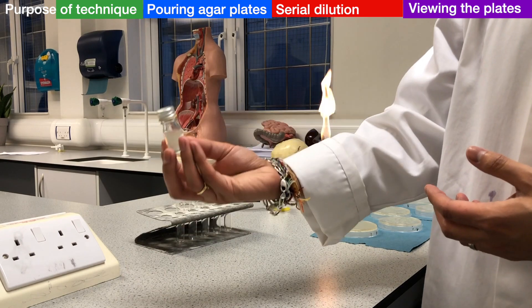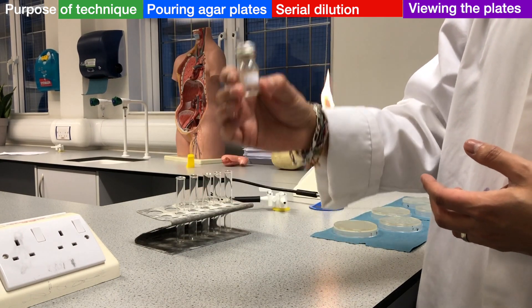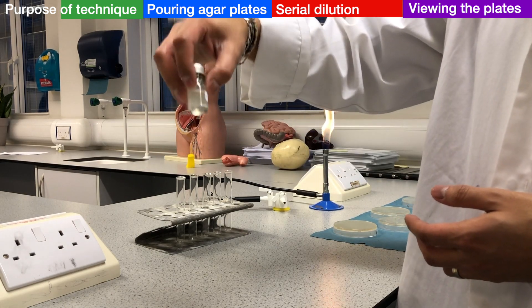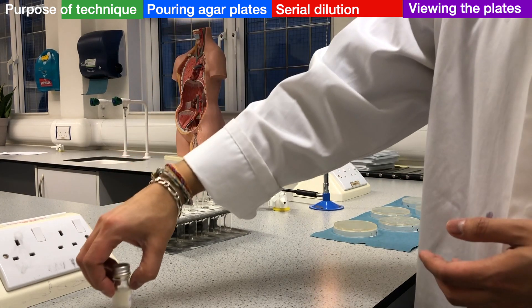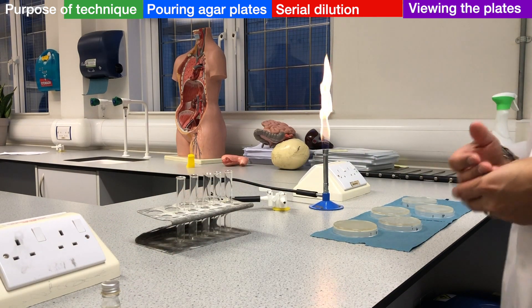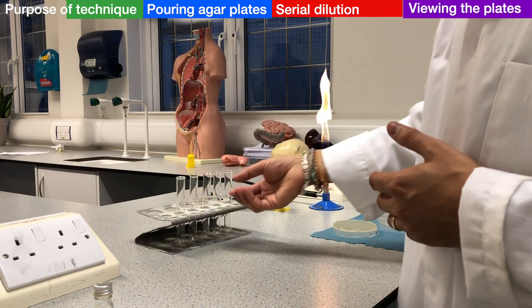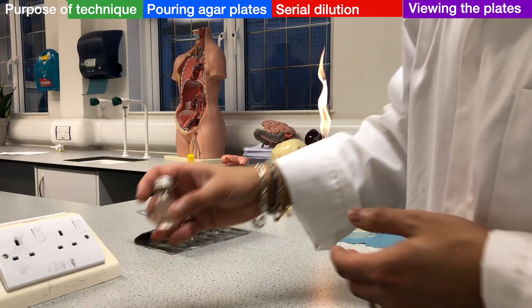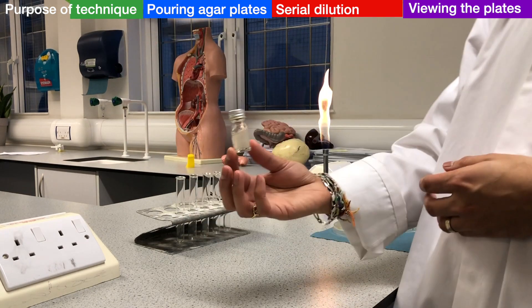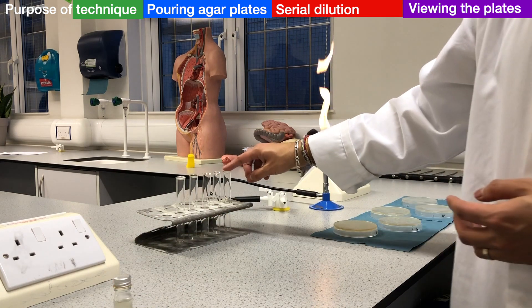So let's say for one of the conditions we have our bacterial culture, the bacteria have been growing for some time, and we want to now measure the density of this bacterial culture. What we are going to do is first make a serial dilution of this bacterial culture in these tubes.